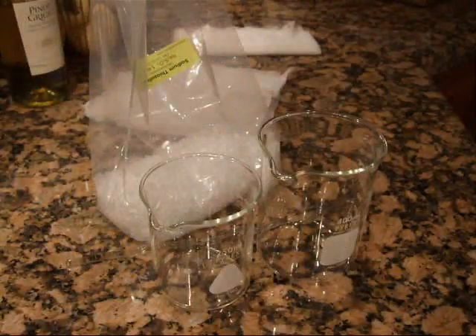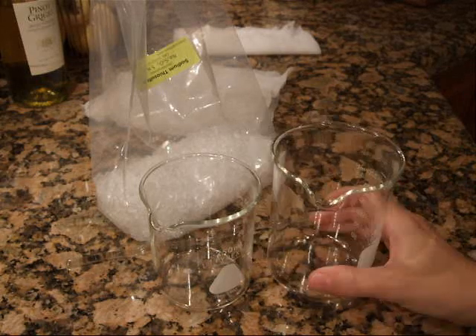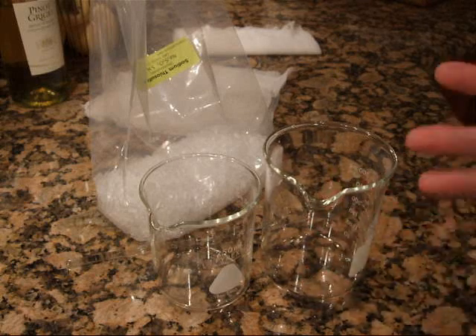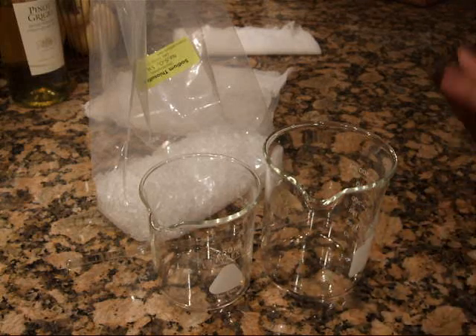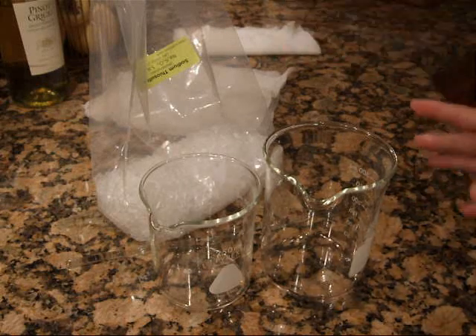Crystal Blessings everybody! I decided I'm going to do one of my favorite experiments that I do with students, and that is growing crystals in a lab. So you can see how crystals grow from a super saturated solution that was heated and then cooled.